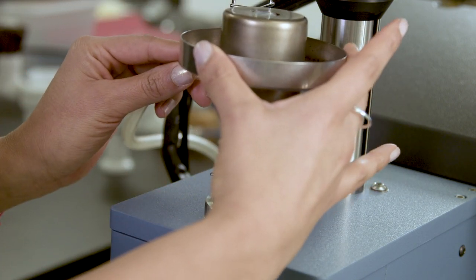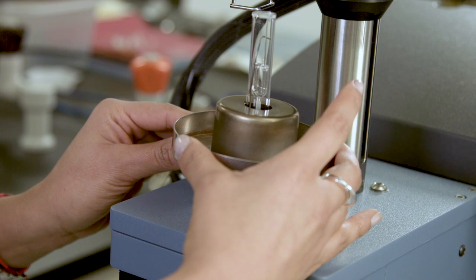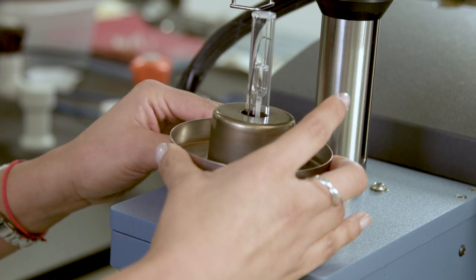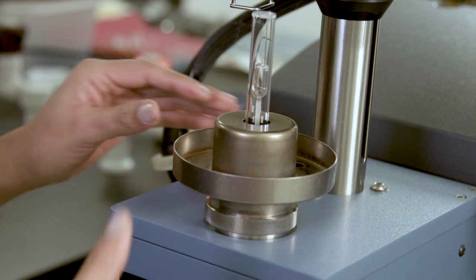Hold the thermocouple against the stage and put on the spring clip to keep the thermocouple in place. Finally, place the stage shield or drain cup on the stage, aligning the slot in the bottom over the thermocouple.